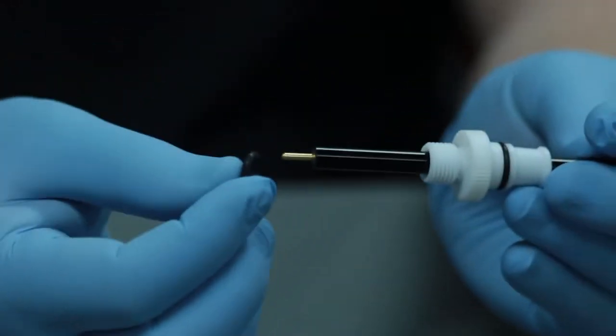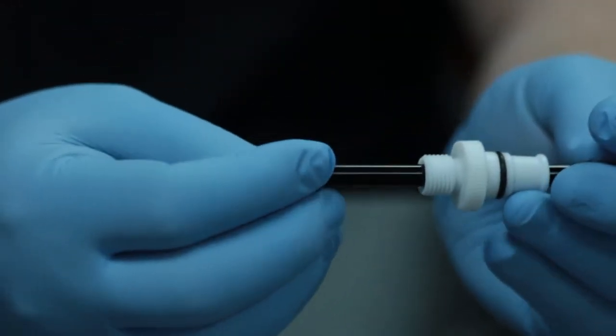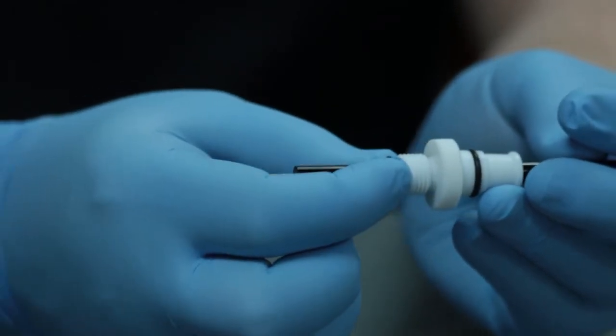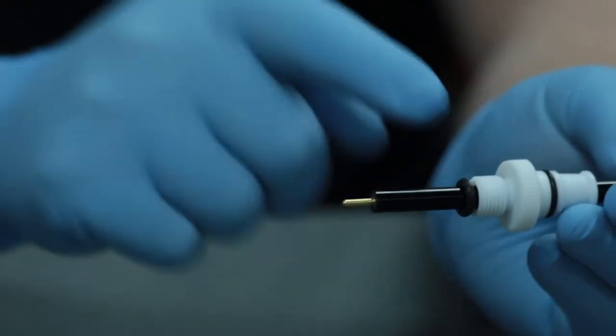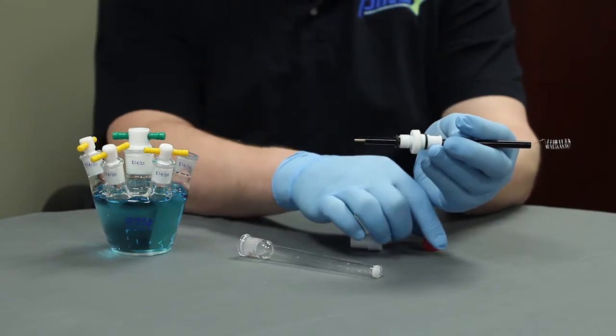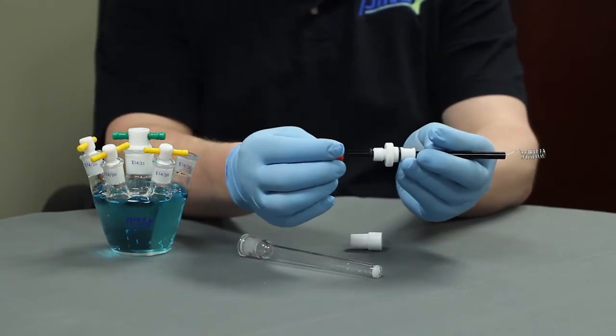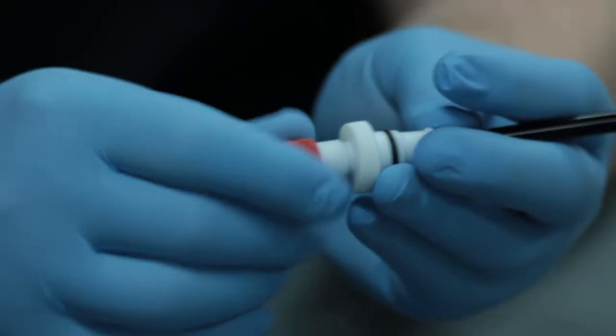Next, place the O-ring onto the shaft on the pin end and slide down next to the Teflon adapter. Lastly, followed by the red cap of the outer Teflon adapter.